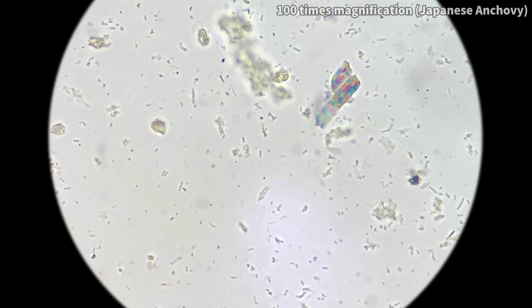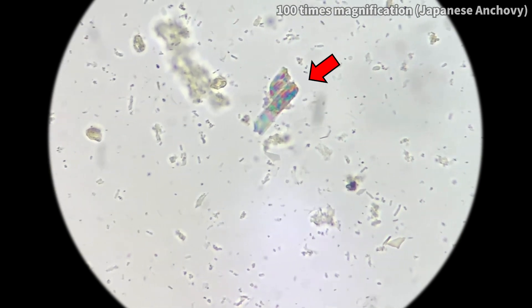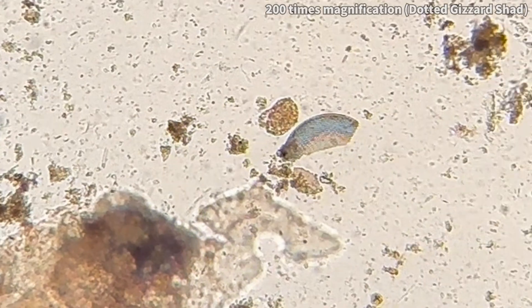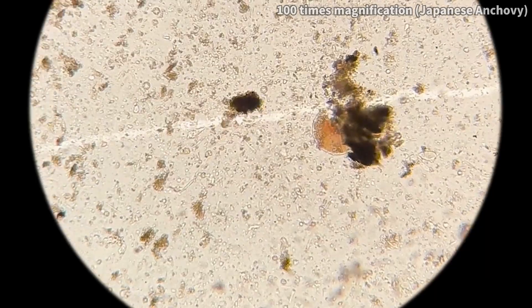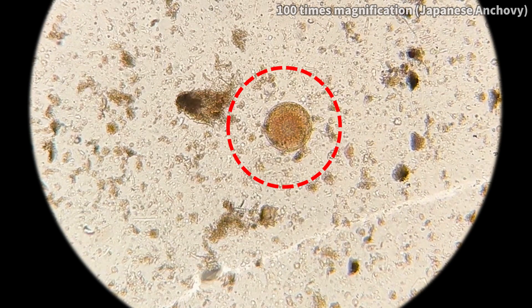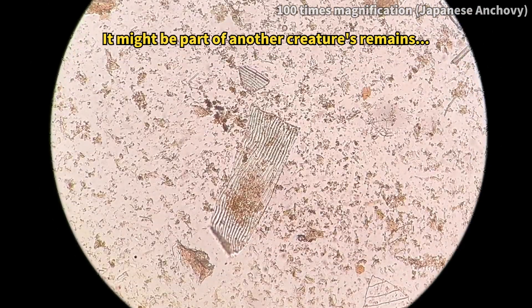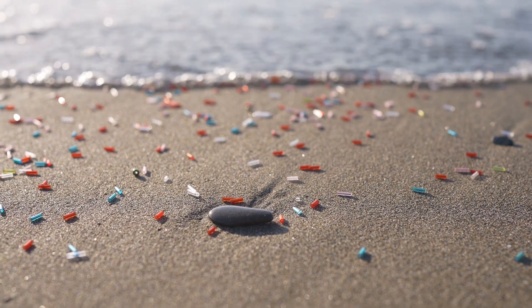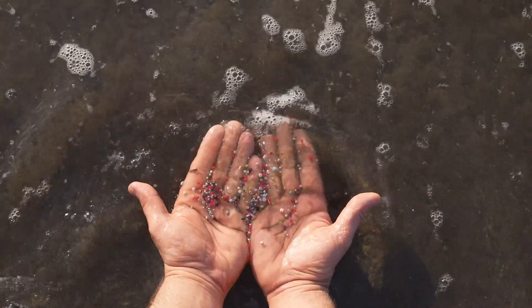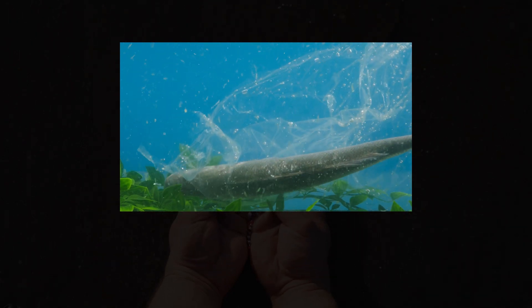We searched the materials that seemed like microplastics — and here they are. See this glittering object? These are presumed to be microplastics, appearing in various forms. There were more substances likely to be microplastics than expected. While some might not be microplastics, the likelihood they are plastic is quite high, because microplastics are commonly found in many marine organisms in the ocean.